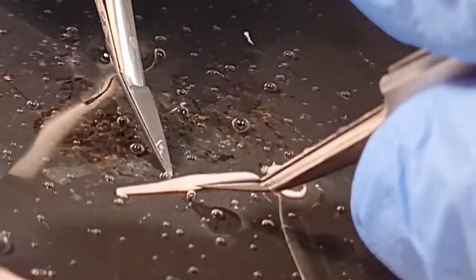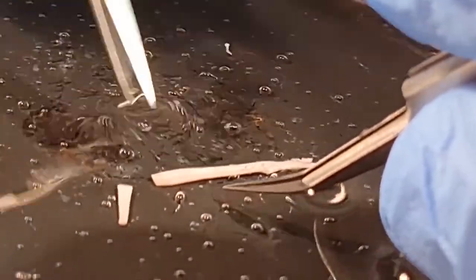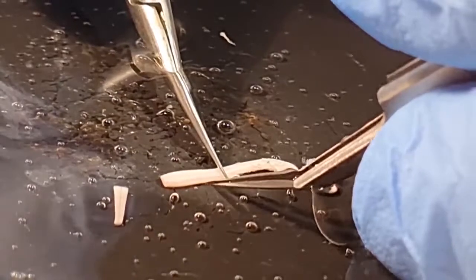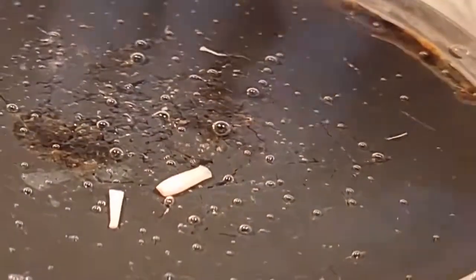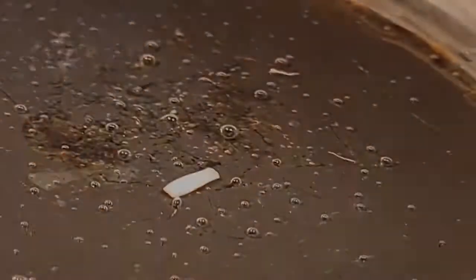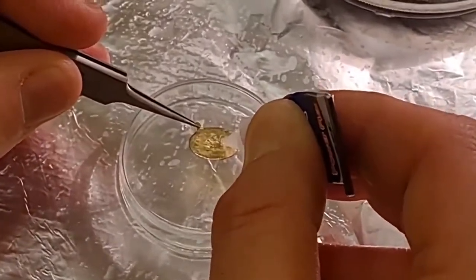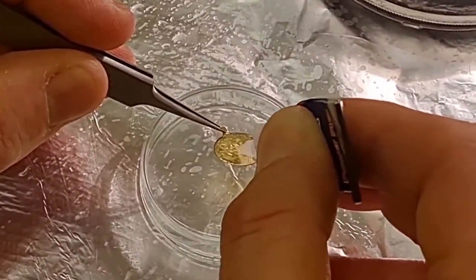At the end of this procedure, you have a clean surface of the spinal cord, and now you cut out the region of interest for the block preparation. We are now cutting out the lumbar enlargement segments from L1 to L6. On the dorsal surface of the cord, the 2 vertical gray bands indicate the dorsal horn. The next step is to fix the spinal cord prep to a gold plate by fast glue.